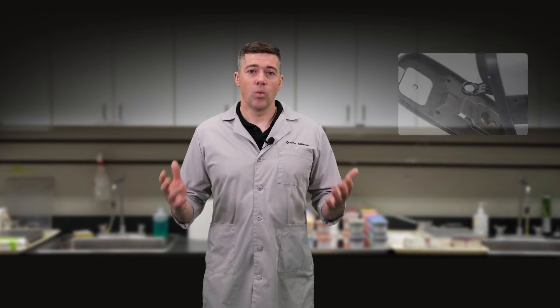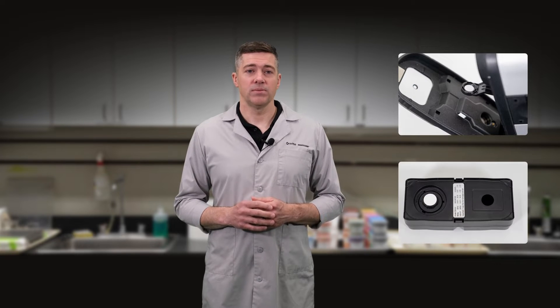In a perfect world, it might be enough to rely on factory initialization and never calibrate your instrument again, but no environment is perfectly stable nor free of contamination. That's why daily calibration is important. This regular checkpoint adjusts for everything from lamp performance to minor dust contamination in your instrument. It is typically conducted using a white, or white and black, calibration media.